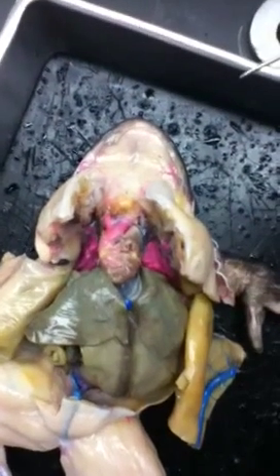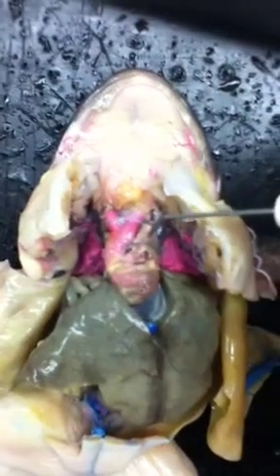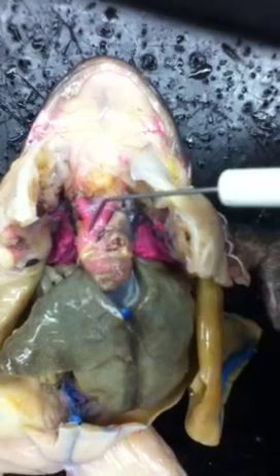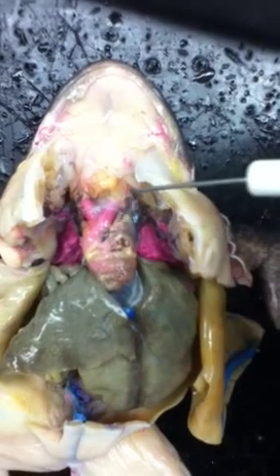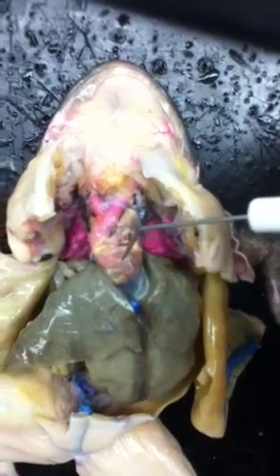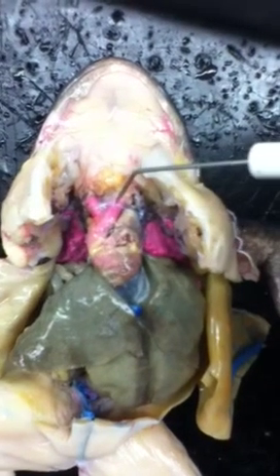This video is about the arteries and veins of the frog. Starting up at the heart, the parts of the heart include the atrium — left and right — which is the top part of the heart. The bottom of the heart comes to a V shape, and that is the ventricle.